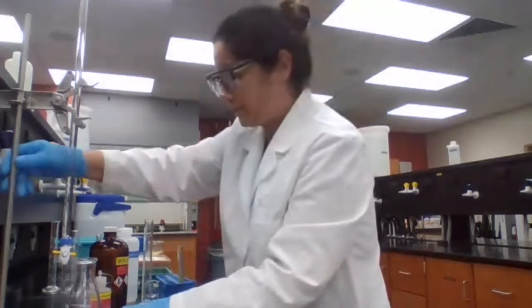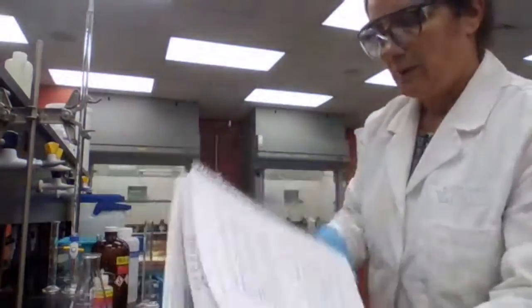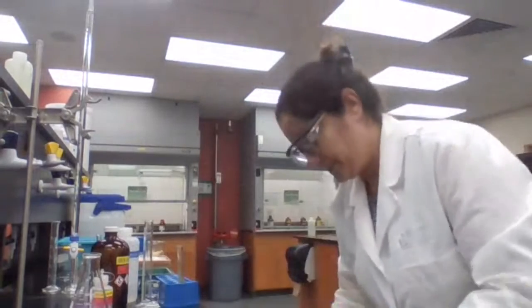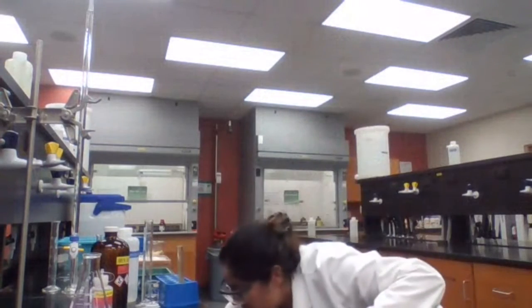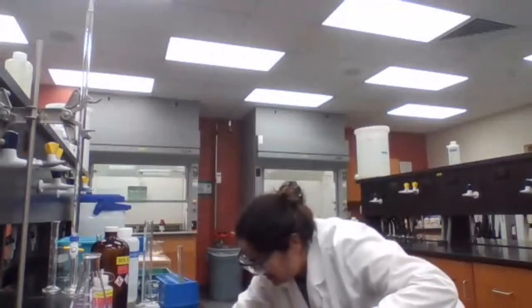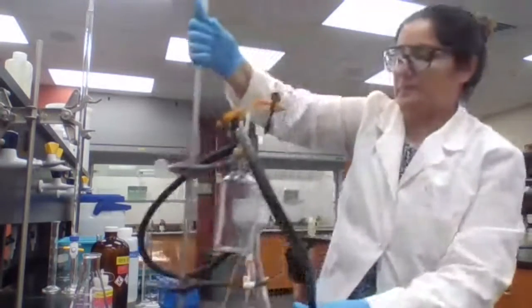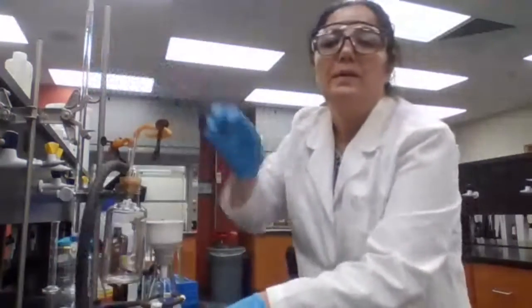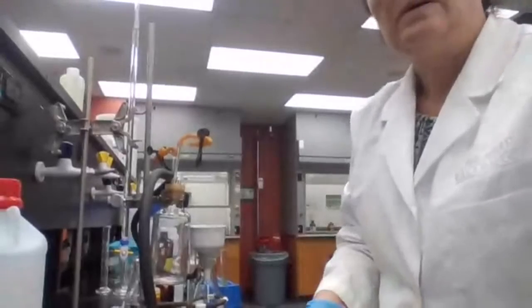So what would be the next experiment? Which other test do you want me to do? Okay, chromic acid.